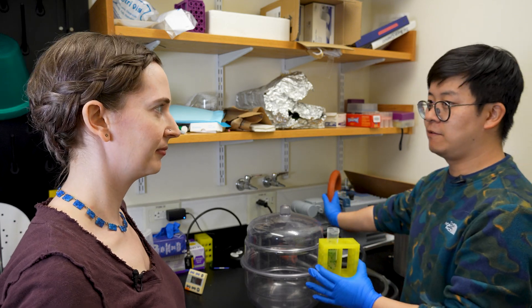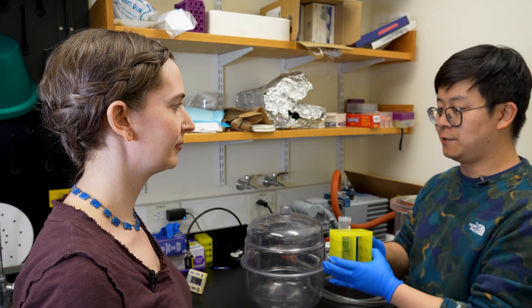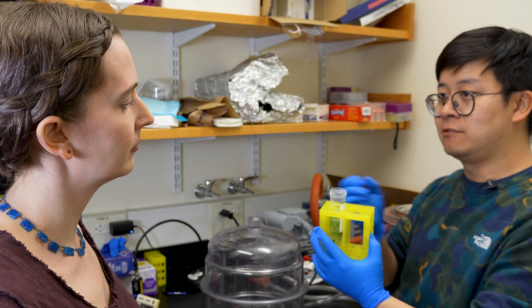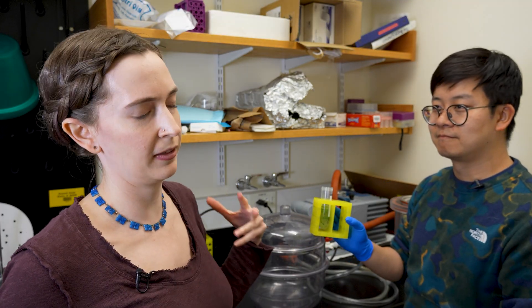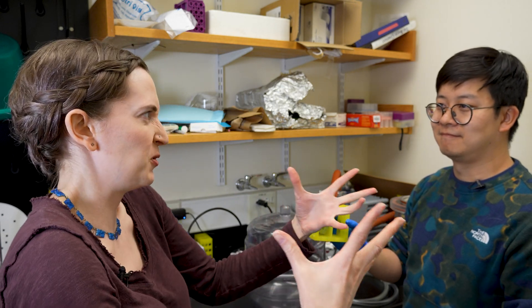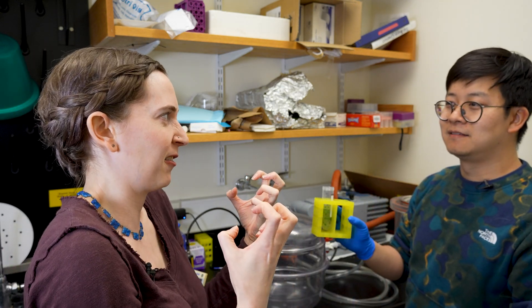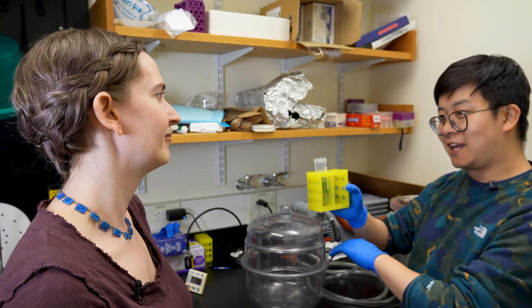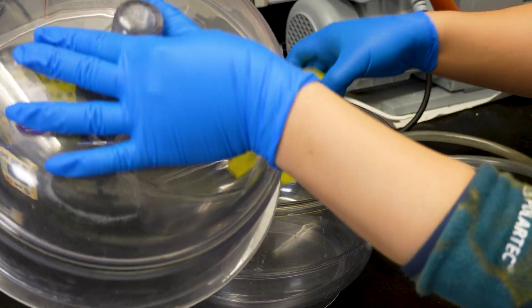Now we're going to use this vacuum infiltrator to apply a very strong vacuum. This will allow the bacteria to be forced into the tissue. So just soaking in an Agro bath isn't enough to do the transformation — you need to use a vacuum to suck all the Agro into the cells. That's right. Otherwise you only expose the outer surface and not the internal tissues.